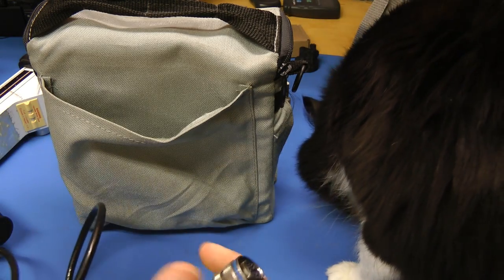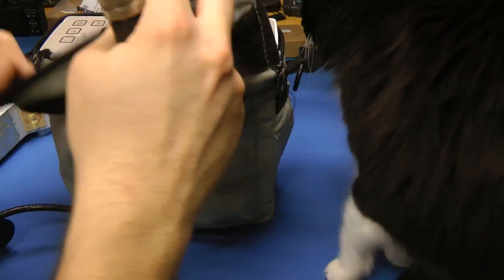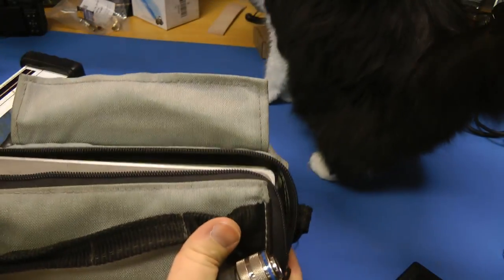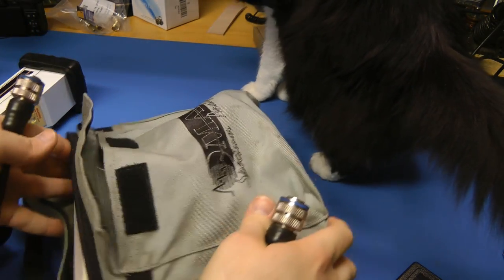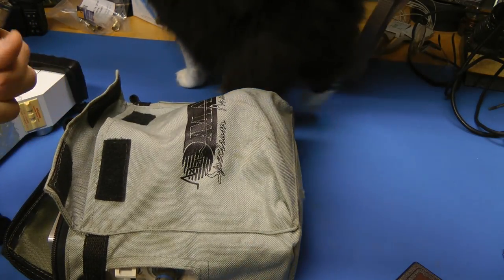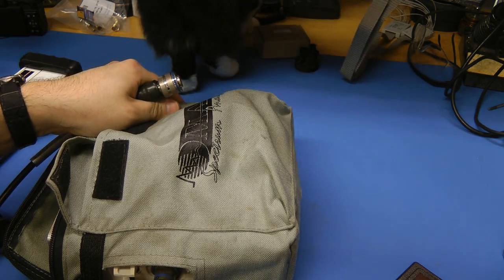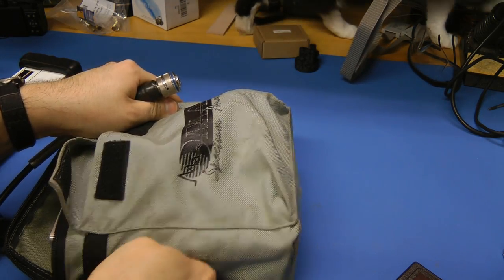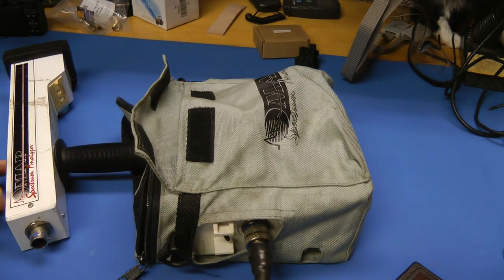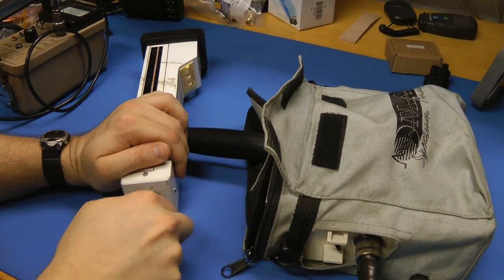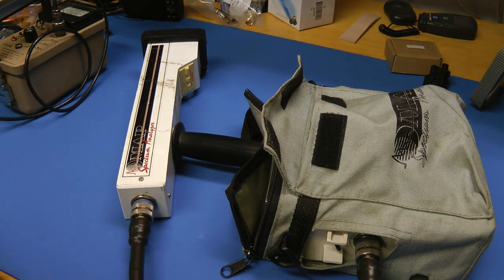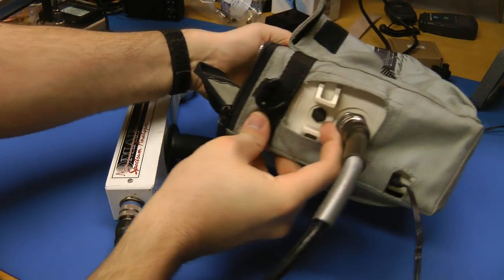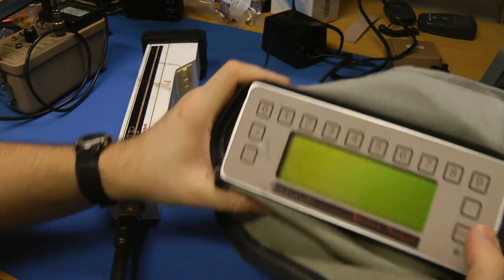Let's connect this up and see what it does when we power it up. I'm almost certain the source is completely dead after all this time, given the short half-life, but it's worth seeing if it does anything. So that's probably the power switch there, so let's see what this does.